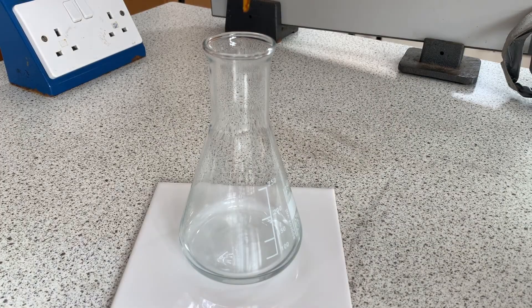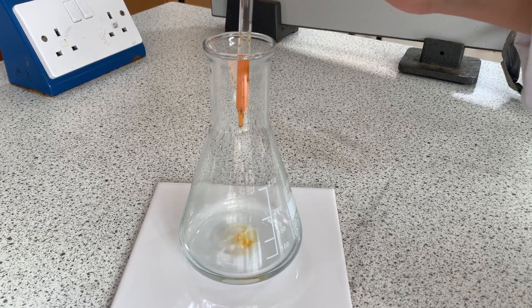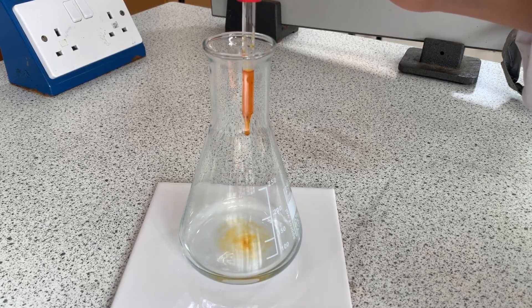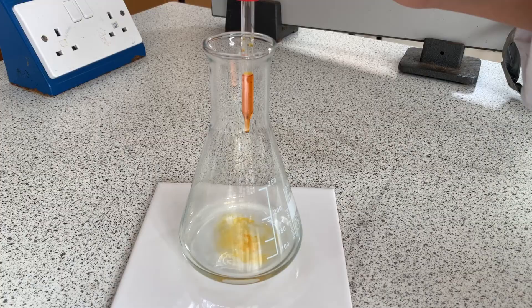Here I'm adding five to ten drops of the methyl orange indicator to the conical flask which contains 25 centimetres cubed of sodium hydroxide.